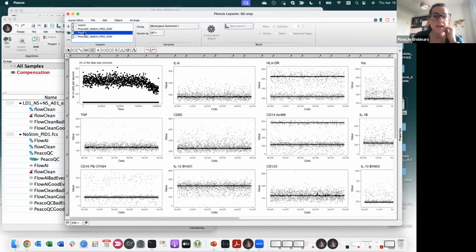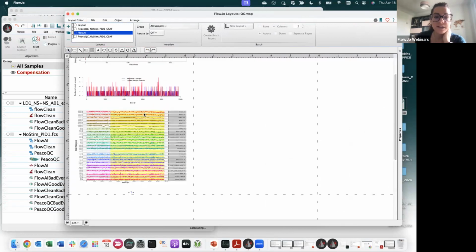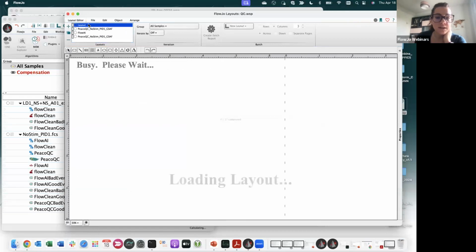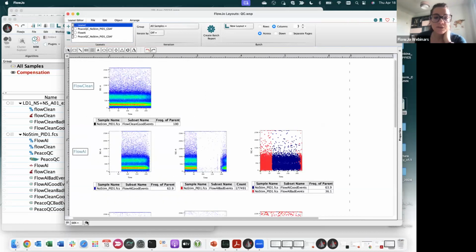Everything seems okay. When I look at the output from FlowAI, this is the same that I showed you in the presentation. I can see how the flow rate was changed, the removal of marginal events, of events from the dynamic range, and then I see the median intensity value. Okay. And then what you can do is overlaying bad events and good events and see where they are located. So I did that in advance, but it's basically just dragging and dropping your raw sample right here, and plotting a physical parameter versus time.